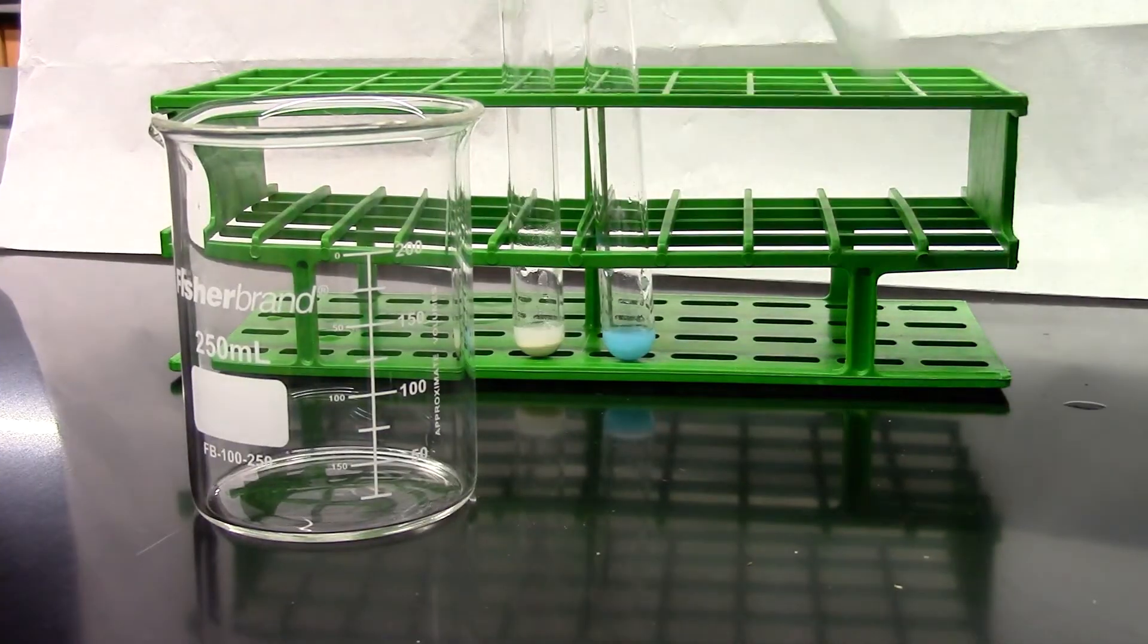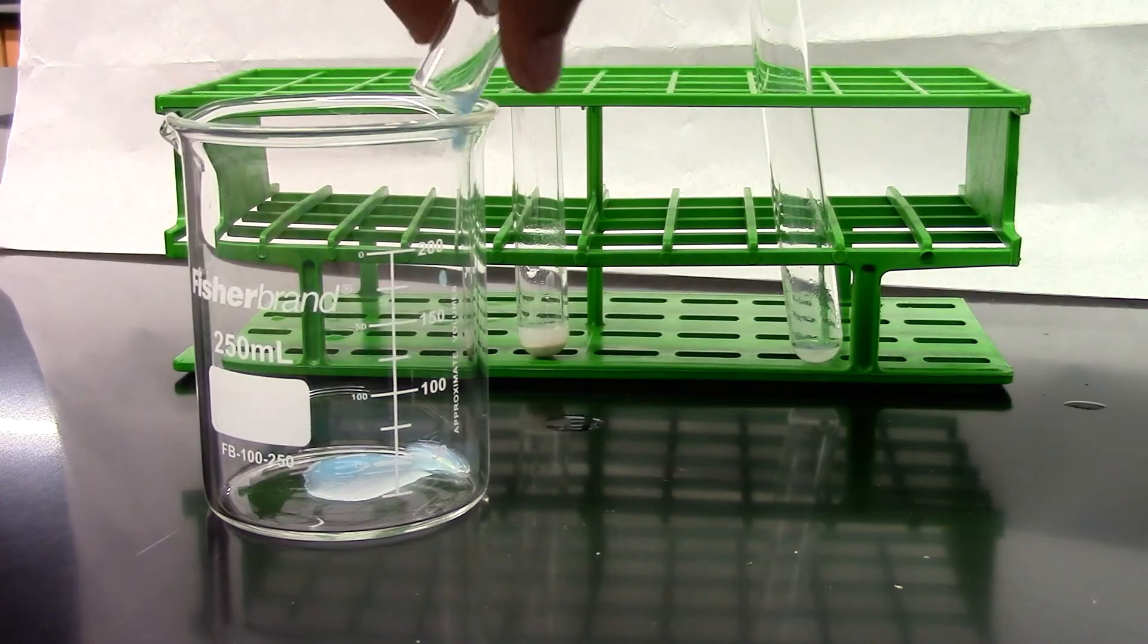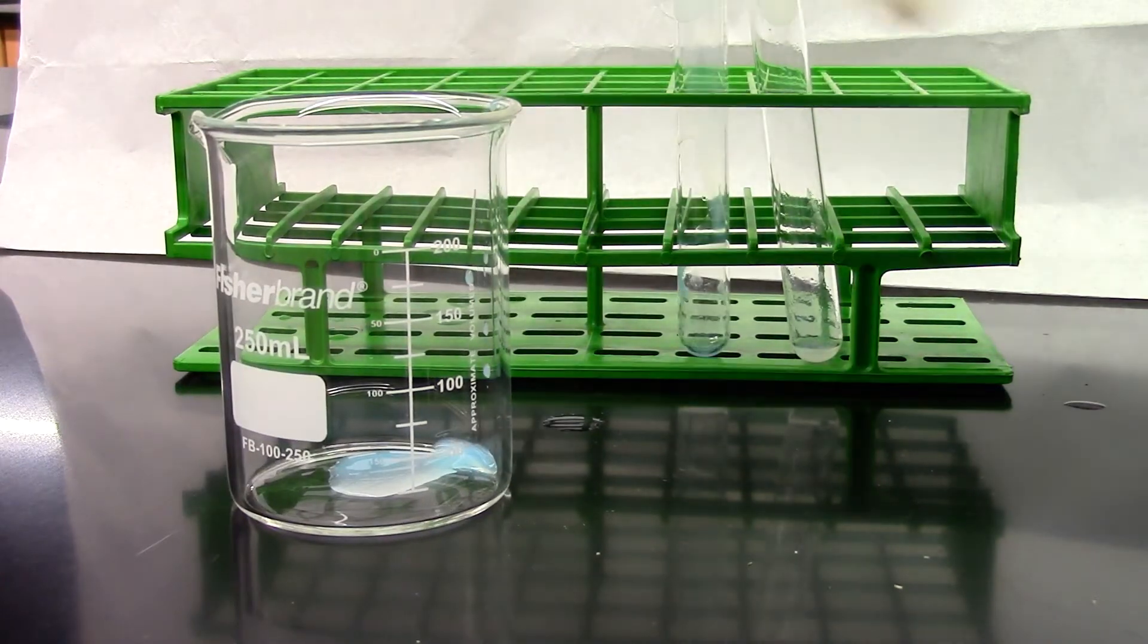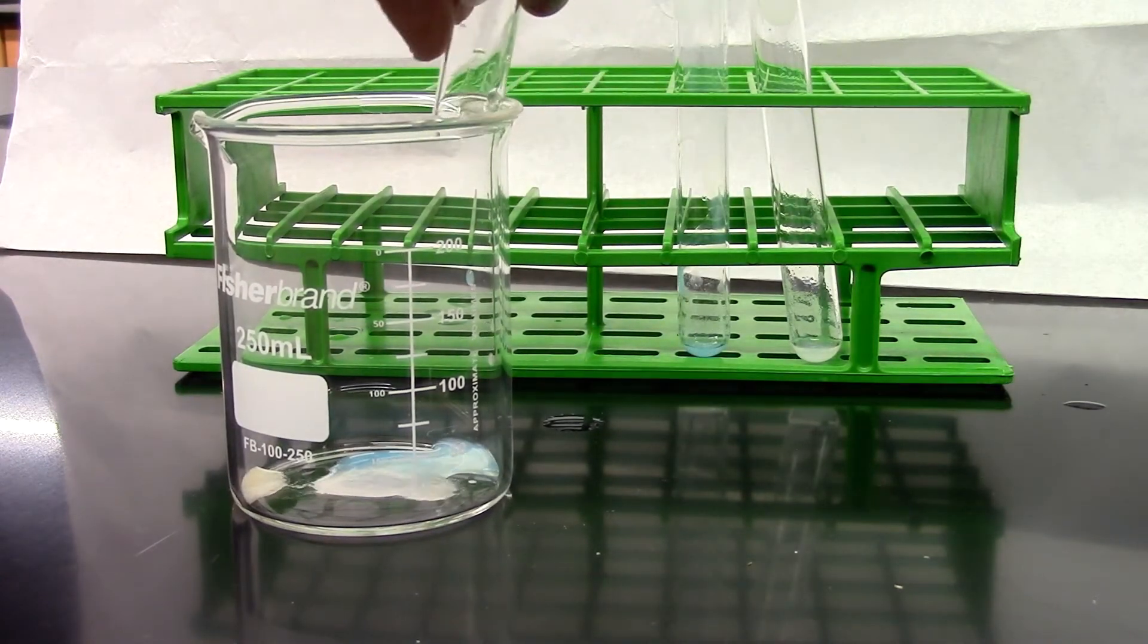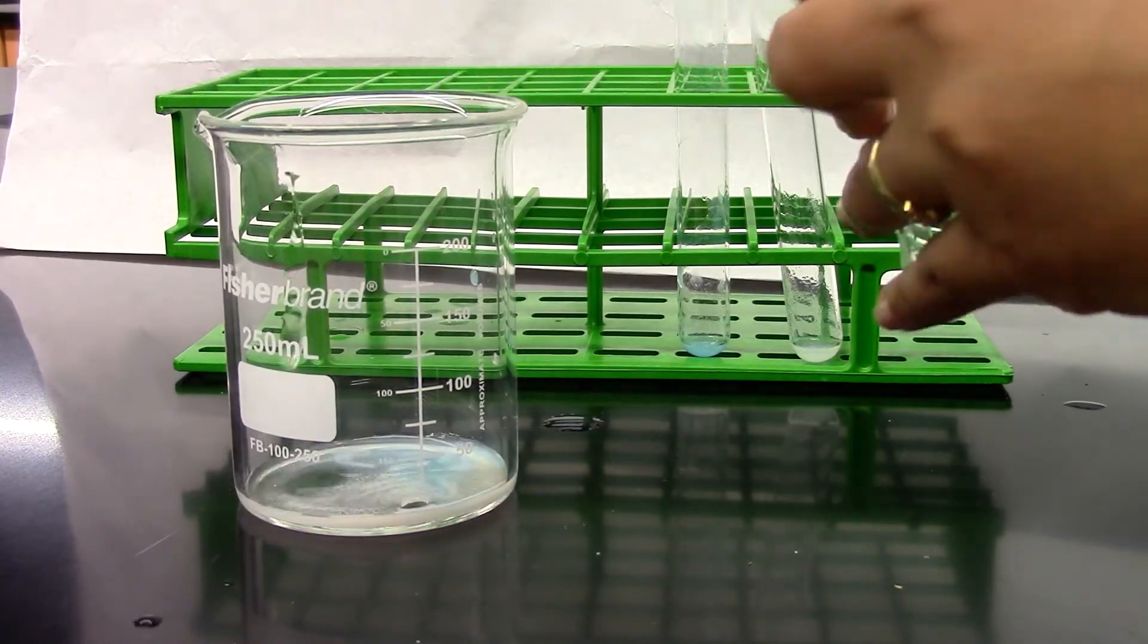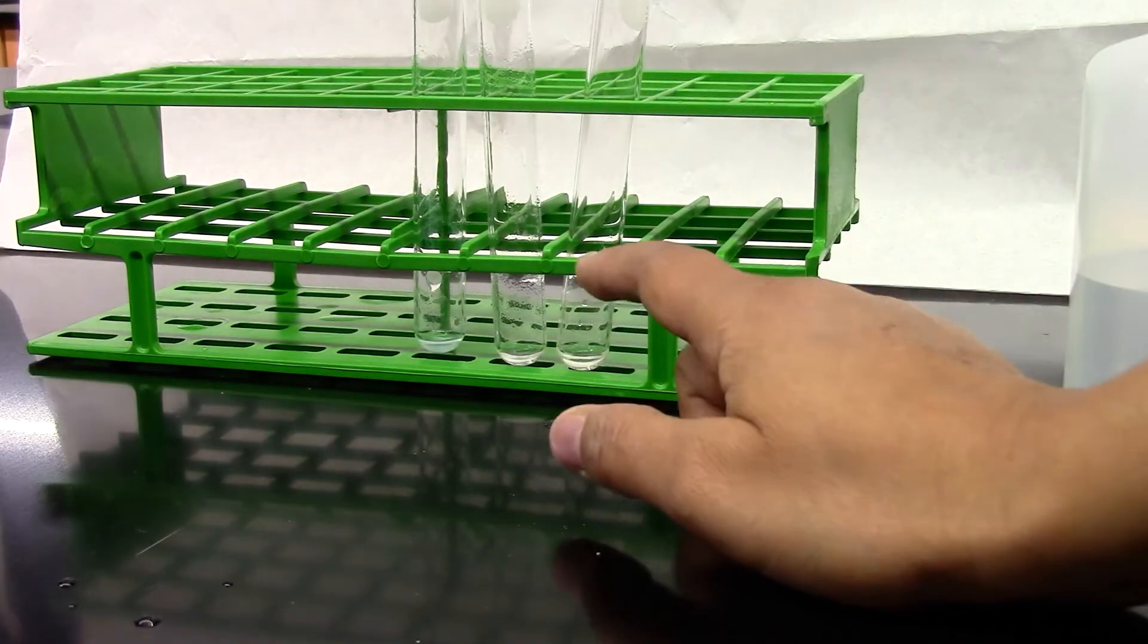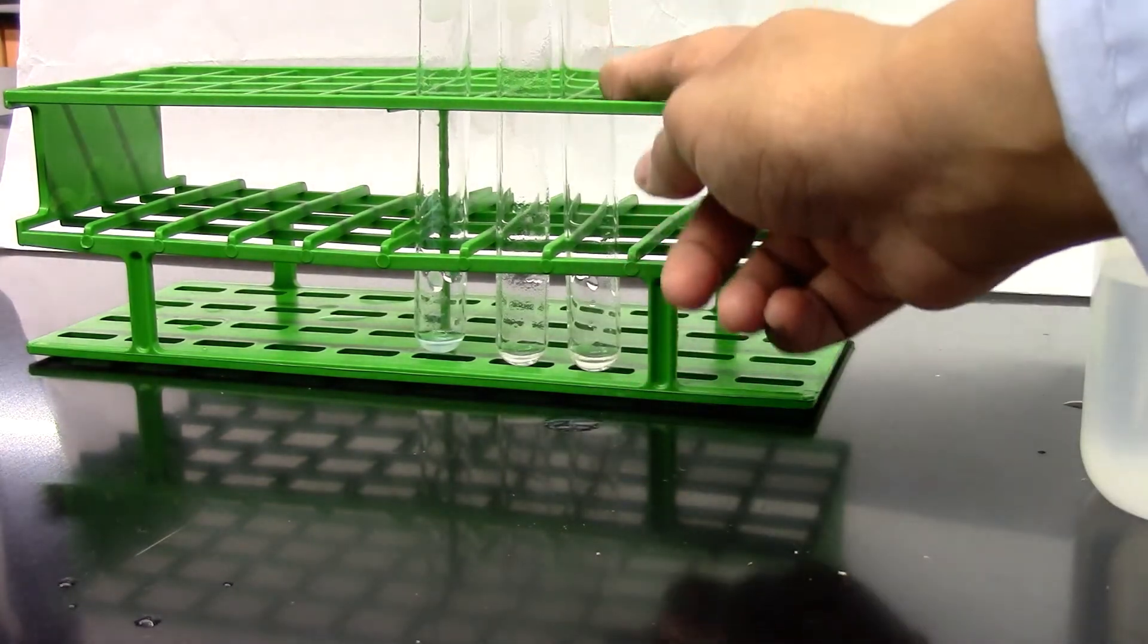So I'm disposing all this metal solution into a beaker. And then at the end these metal solutions will go into a labeled waste bottle in the hood. Now the test tubes could be rinsed in the sink and will be ready for use for the next reaction.